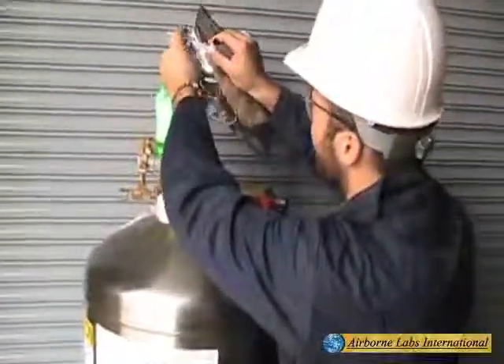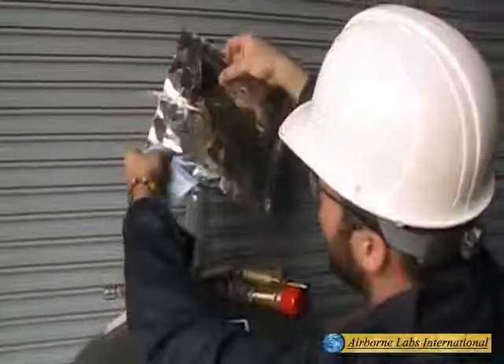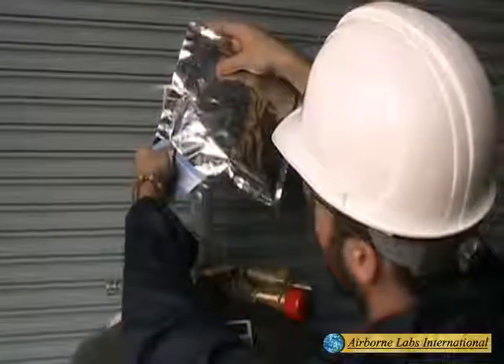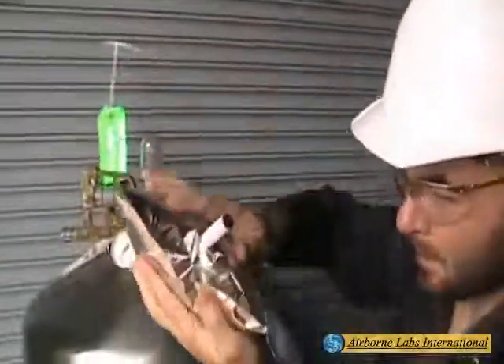This filling process can be accelerated if needed by gently pinching the soft, tight Tygon tube part of the T-Fitting. Do not overfill an MLB, as this can cause it to leak or violently rupture.